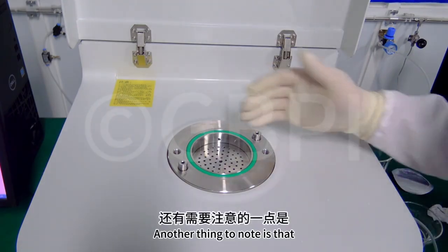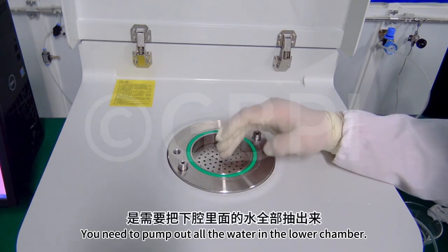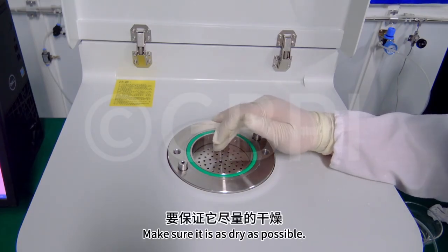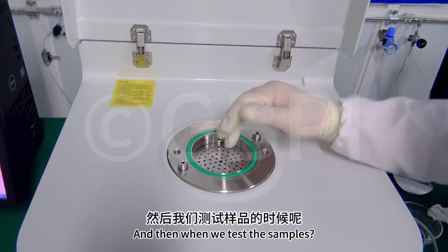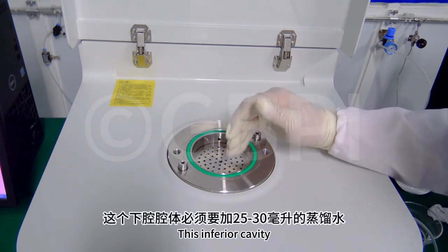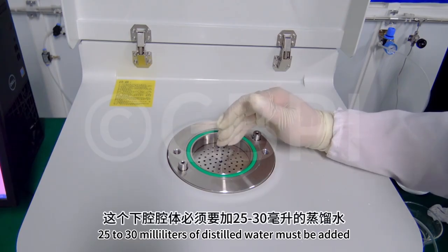Another thing to note is, when you fill the baseline, you need to pump out all the water in the lower chamber. Make sure it is as dry as possible. And then when we test the samples, this lower cavity must have 25 to 30 milliliters of distilled water added.